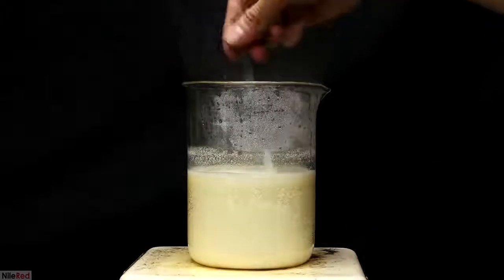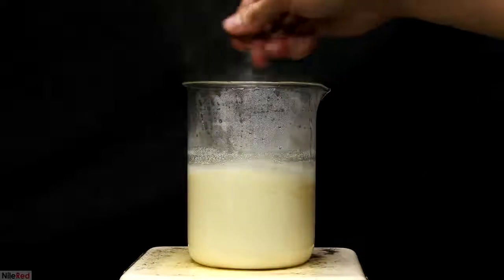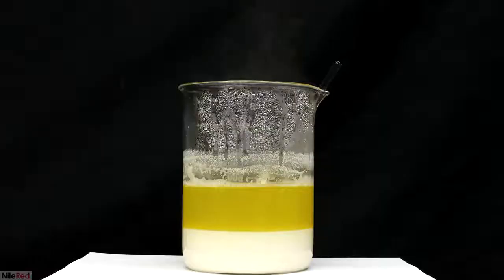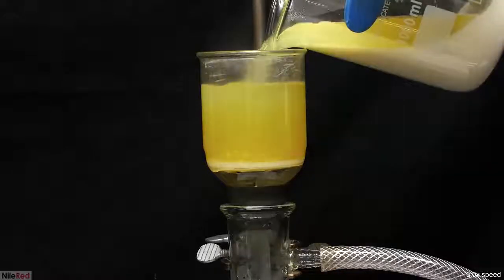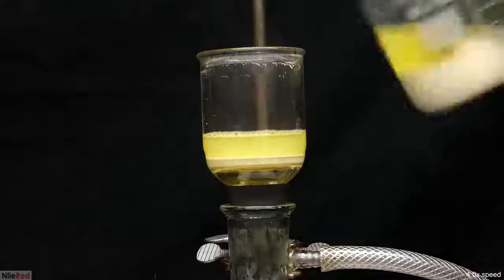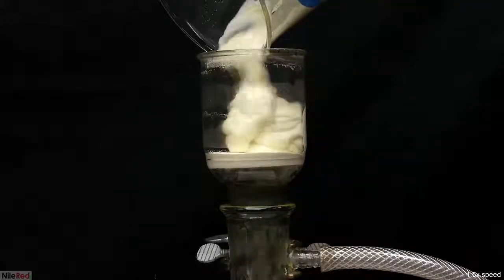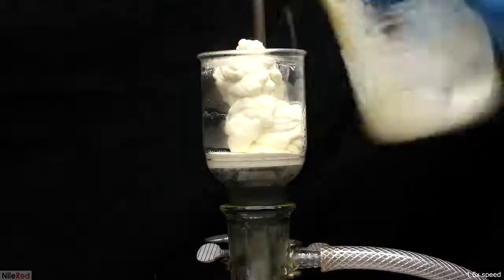Eventually it started boiling, and I stirred it like this for a few minutes. It was then taken off the heat, and the calcium citrate very quickly started to settle at the bottom. While still hot, I went ahead and vacuum filtered it off. The first portion that was filtered off was mostly just liquid, and then the calcium citrate was transferred to the filter funnel.